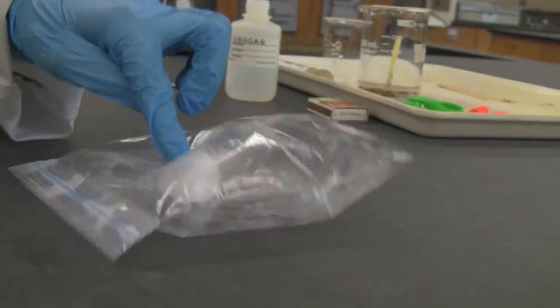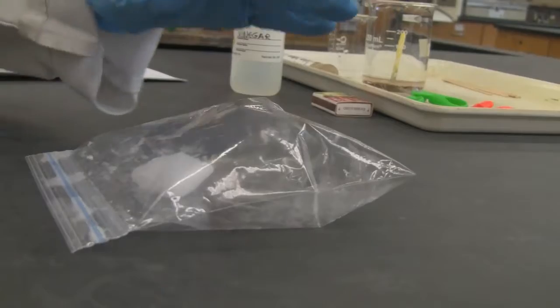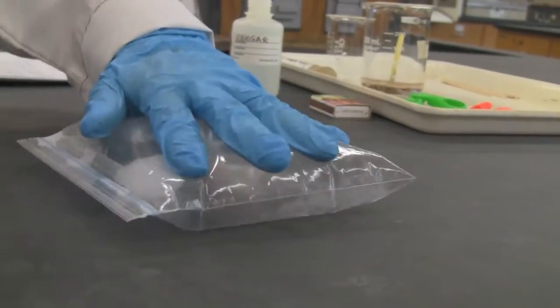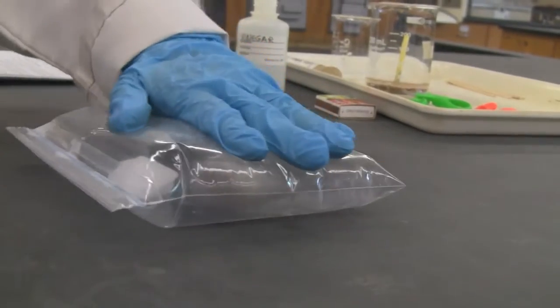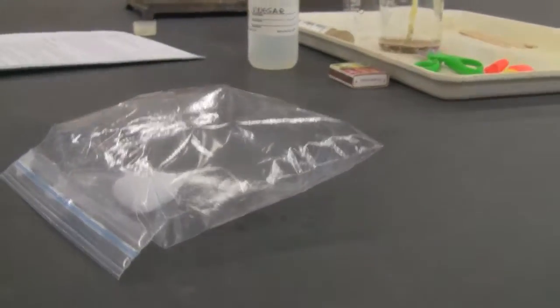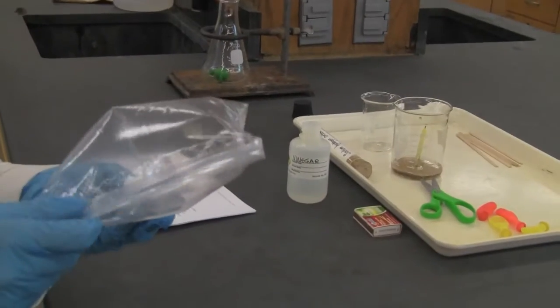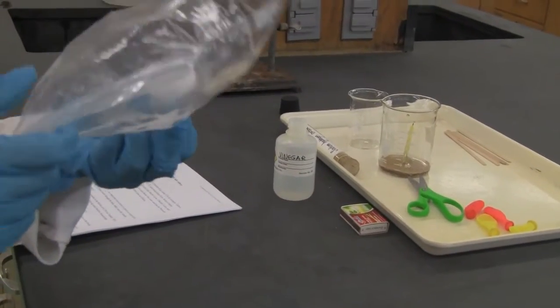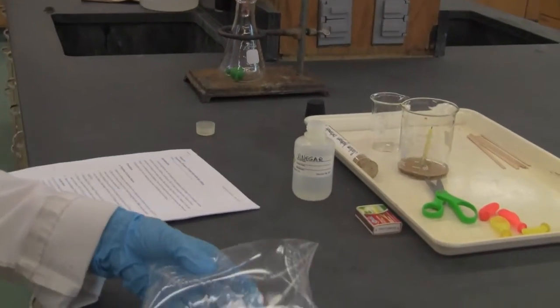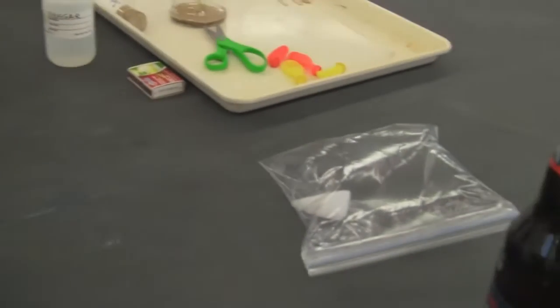Do we see any liquid form? We don't. So this is a solid directly changed to what in there? You can feel something in there, right? Since it's not totally empty, other than the dry ice, there's something else in there. You cannot press it. Okay, so that's the behavior of carbon dioxide. When it's very cold, it's solid. When it warms up, it directly changes to the gas form without the liquid form. Okay. All right. So that's part A.